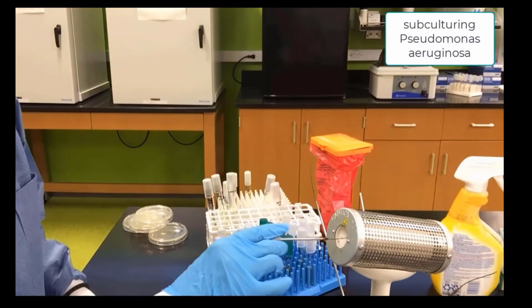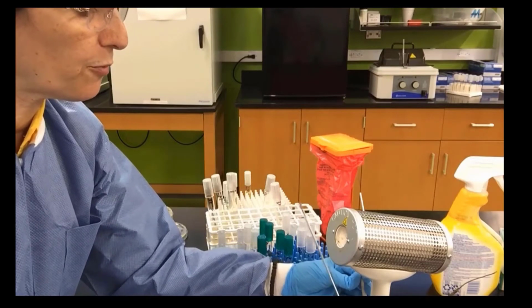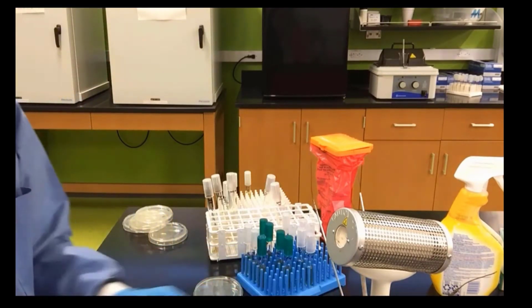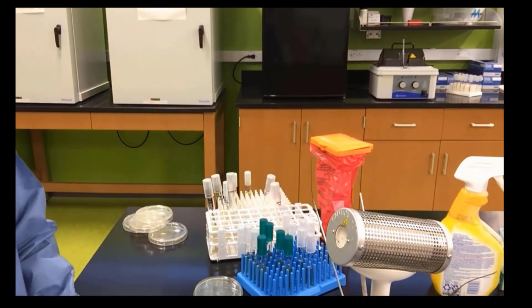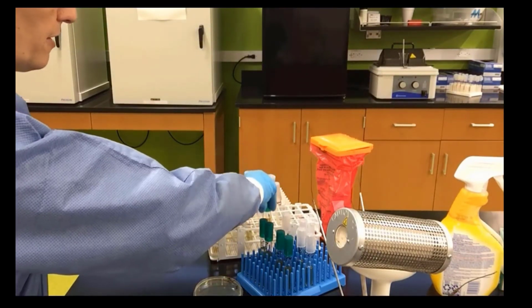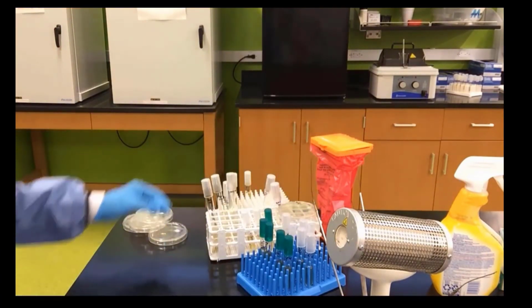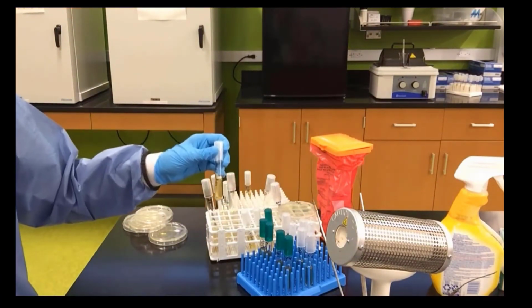We sterilize our needle. And now we are ready for the next bacterium. We pretty much follow the same procedure for all the rest of the bacteria. We want to make sure we keep our tubes and plates organized.